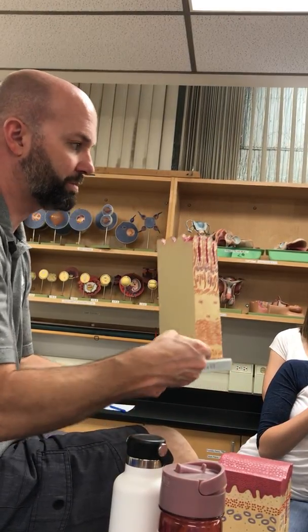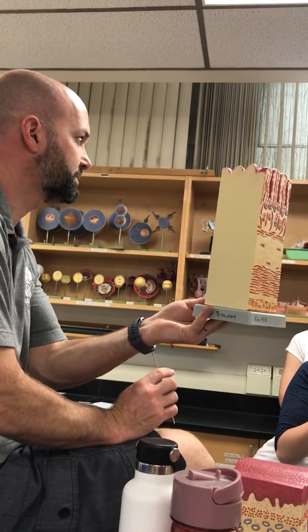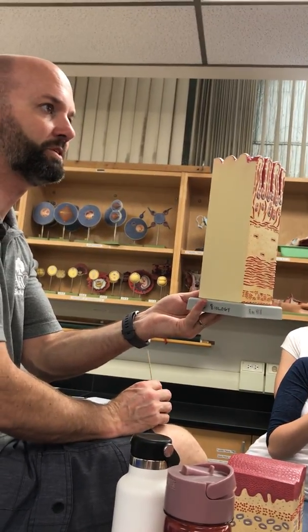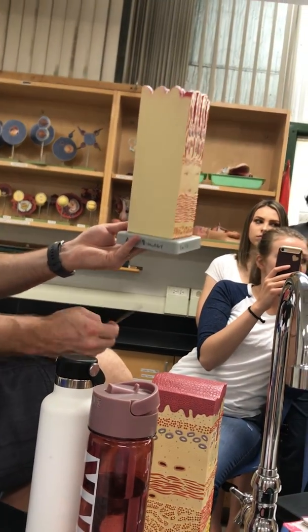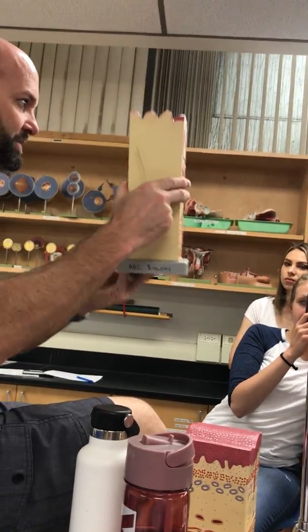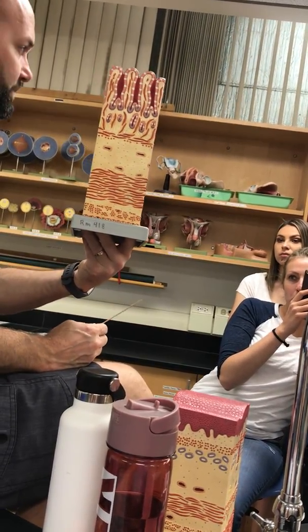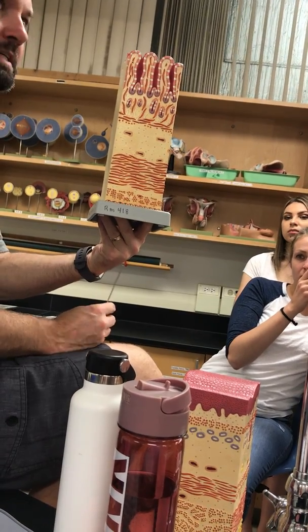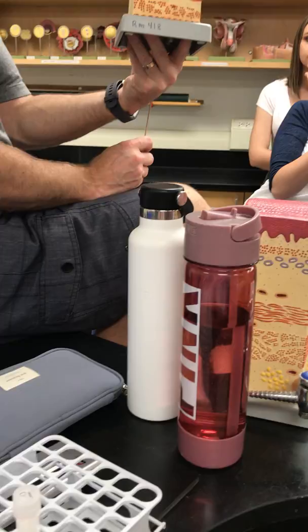Serosa or adventitia at the bottom? Serosa. So what does that exclude? Which part of the small intestine does not have serosa because it's retroperitoneal? Duodenum. So this is ileum. And to confirm, what should be present that is not present here if it was duodenum? Would it be the Peyer's patches? Yeah. Those are in the ileum. Okay. So those are... Duodenal glands.